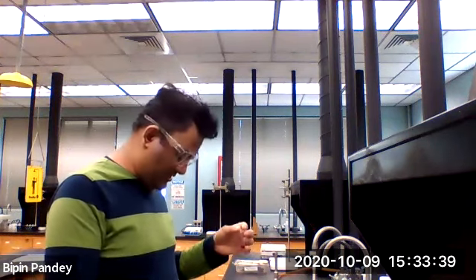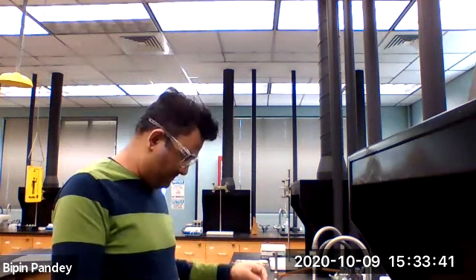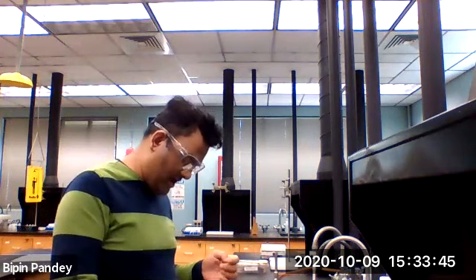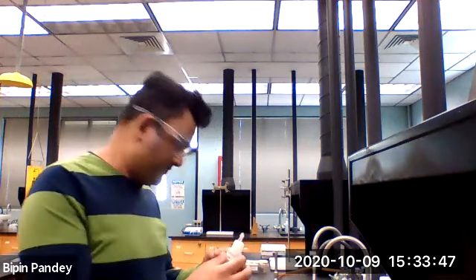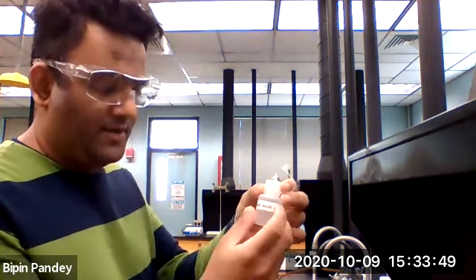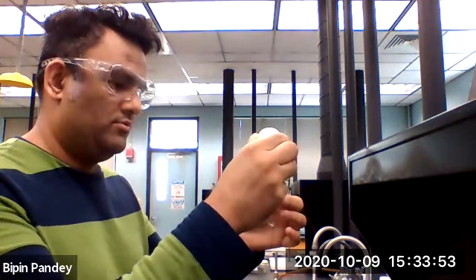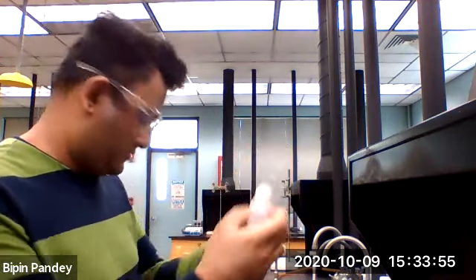Alright, so let me do it again. I have to add first the acetic acid. So I'm adding acetic acid, 5 drops: 1, 2, 3, 4, 5.